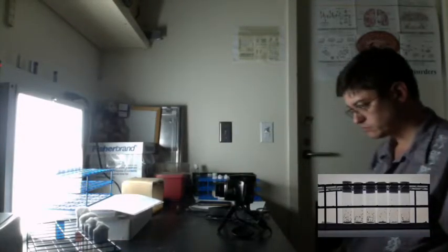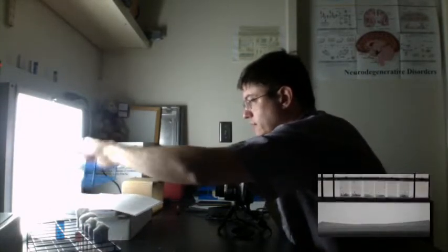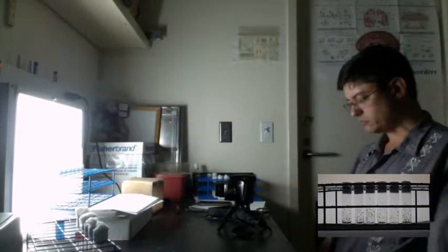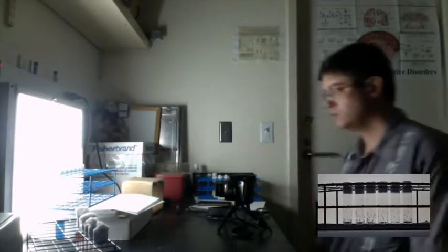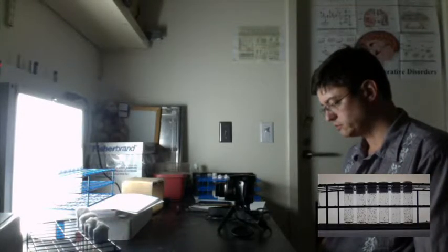So the more times I do this, the better the results are going to be. For some reason, this cork here at the top seems to be sliding down. So I'm going to move that. That's a little better. So I would often try to do this about 20 times or something. And in the analysis part, we will take all of those different runs and do statistics on them so that we would have some pretty reasonable results.